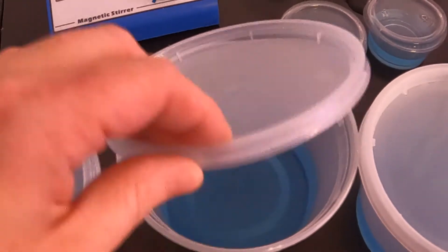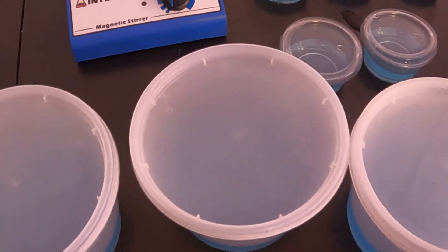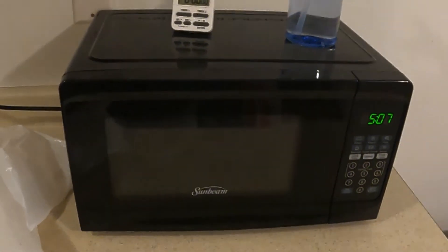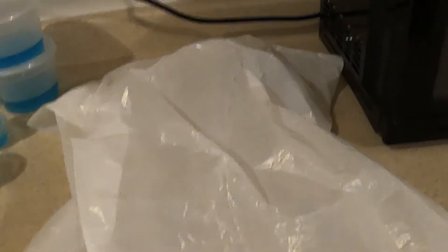After filling my containers I lightly lay the lids on top. We don't want to snap them down just yet. I've cleaned the inside of my microwave and the counter around it with my 10% bleach solution. I've gotten my garbage bag ready and I'm going to spray 10% bleach in here.